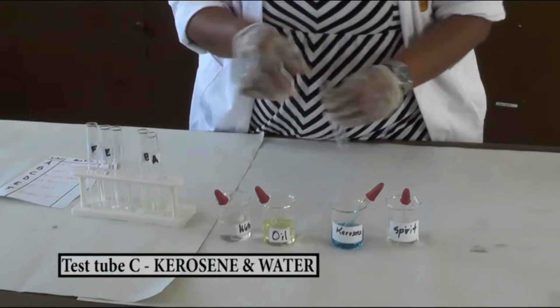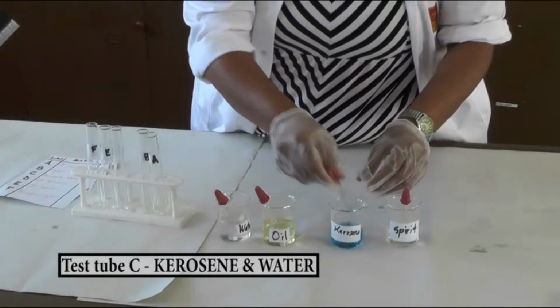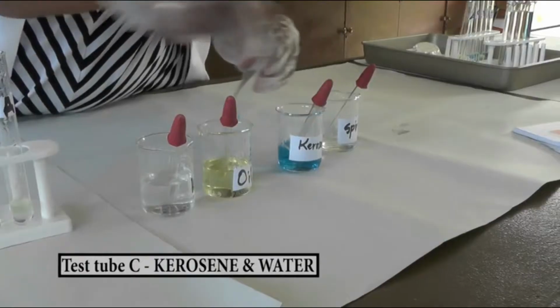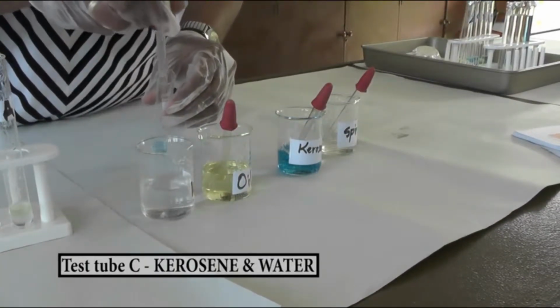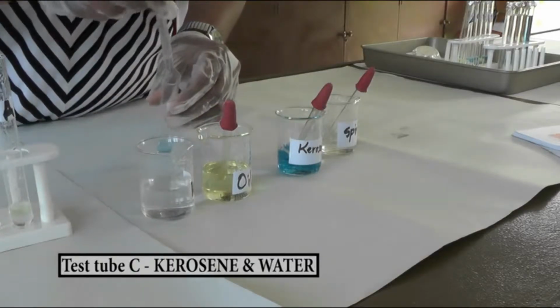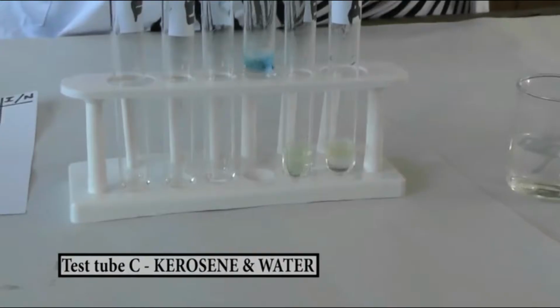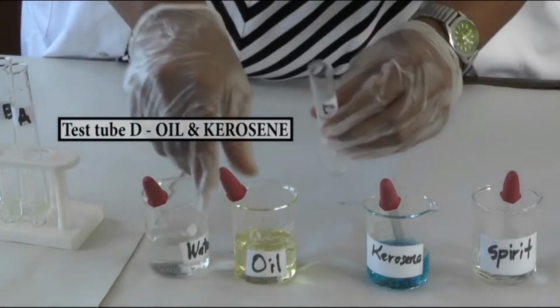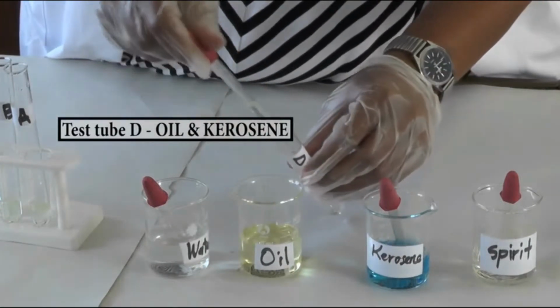For test tube C, we will mix kerosene and water. Put the test tube back on the test tube rack after mixing the liquids. In test tube D, we will be mixing oil and kerosene.